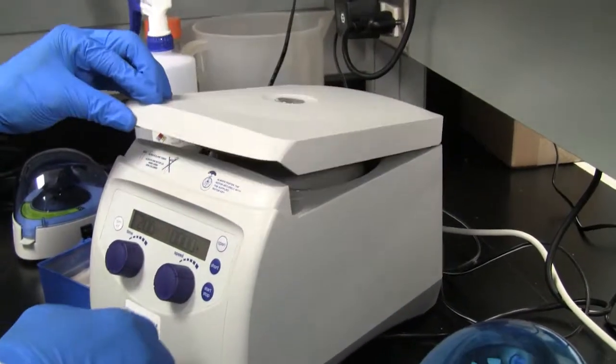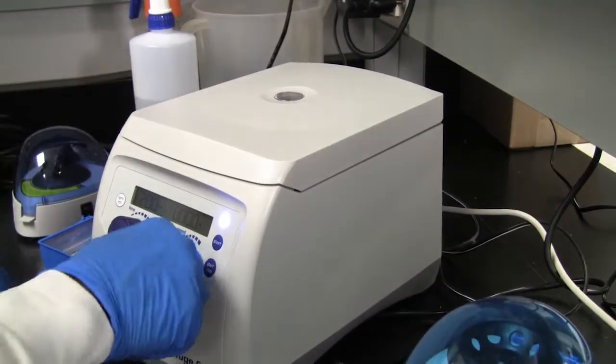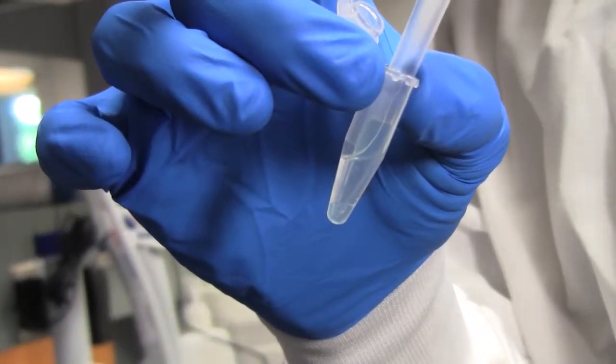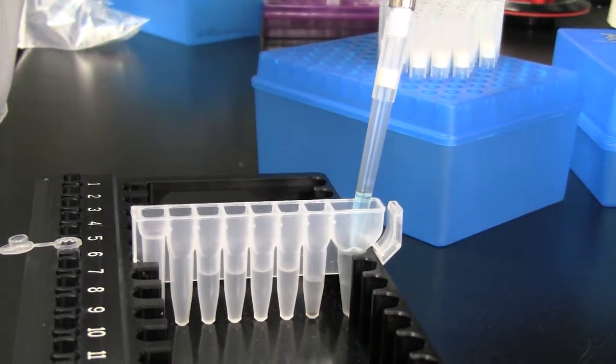Centrifuge at full speed in a microcentrifuge for 5 minutes. Immediately transfer the blue aqueous phase containing the DNA to well number 1 of the Maxwell FFPE cartridge.